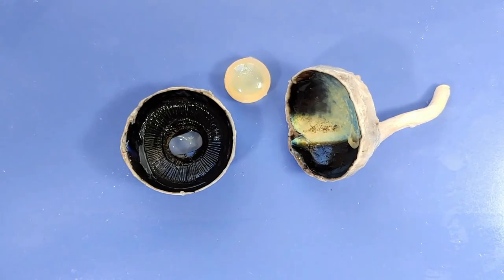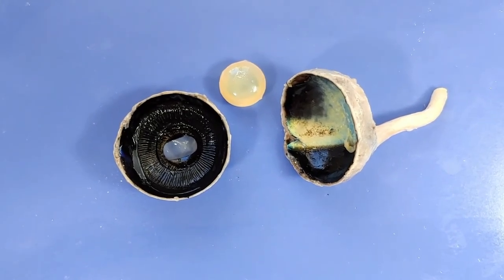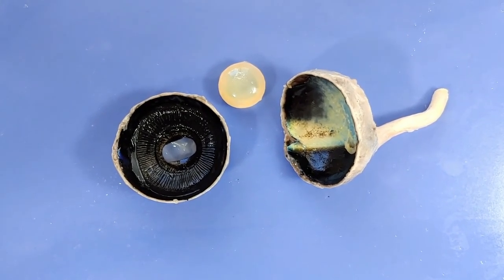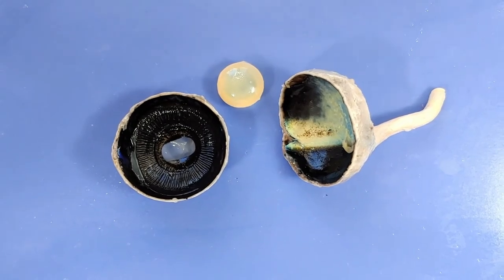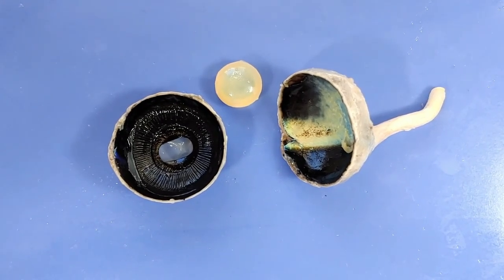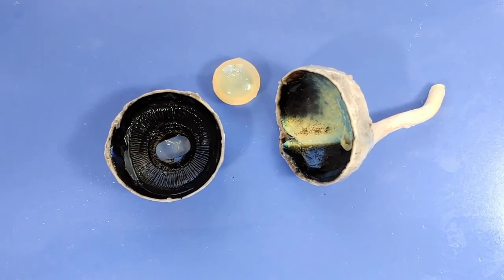That's the end of our eye dissection. Thanks for staying, folks. Here's a fun fact about eyes to send you on your way: the surface tissue of your cornea is one of the quickest healing tissues in your body — the entire corneal surface can turn over every seven days.